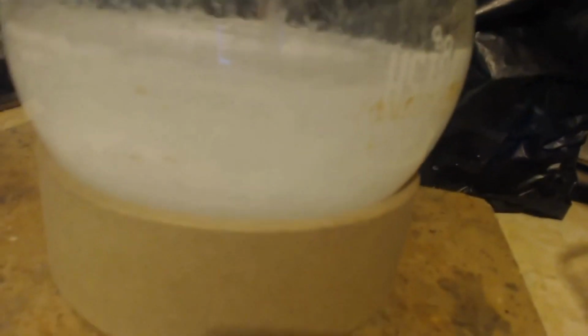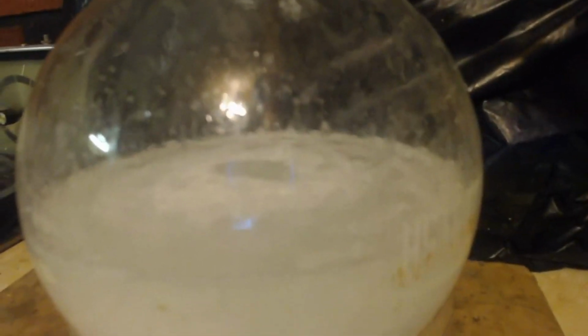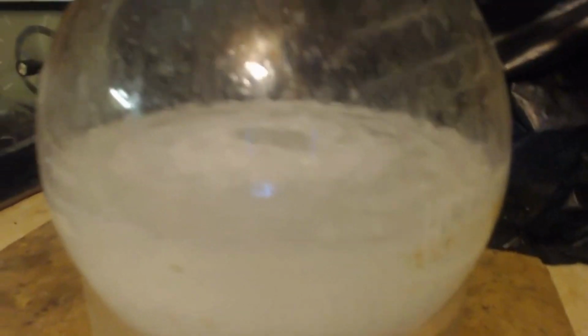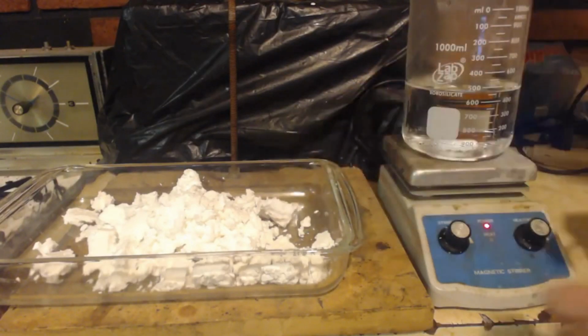Alright, I washed that all up with that 1,000 milliliters of freezing cold water. Sucked as much water out as I could with my vacuum pump. And now this pot here, this stuff that got filtered through, I'm going to put that in the freezer, let some more precipitate out, and do the same thing with that. Push it up with some water, try to get it clean, because there's still some more stuff in there. Well, there it is. I got my stuff.